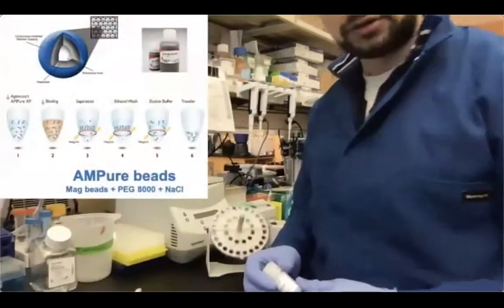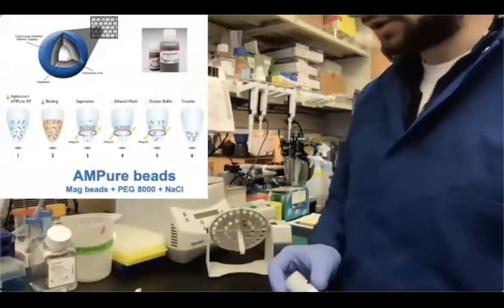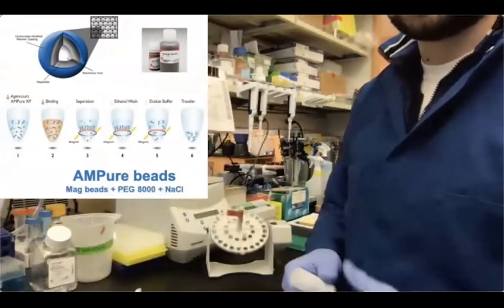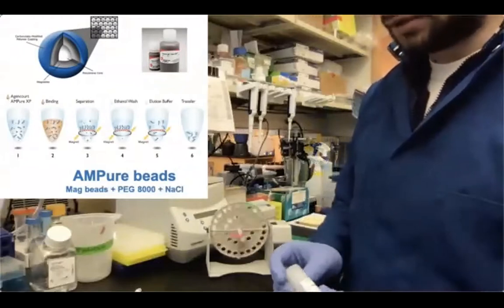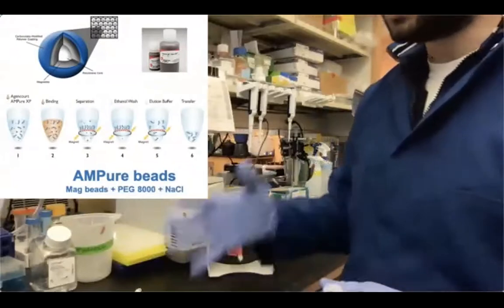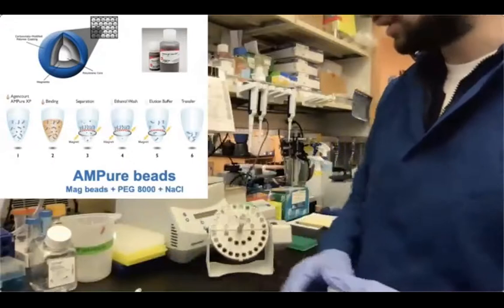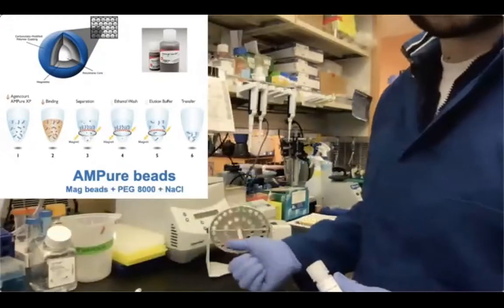All right, so right after we started the program for end polishing and A-tailing, I usually remove my AMPure beads, which are the beads that we are going to need for purification of the adapter ligated and prepped libraries. And they are usually stored at 4 degrees if we're talking about AMPure beads or similar. There's also another version, called SPRI beads. They're usually kept at room temperature. So the only thing that you have to do for the SPRI beads is to resuspend them. I usually just briefly vortex them and keep them in rotation.